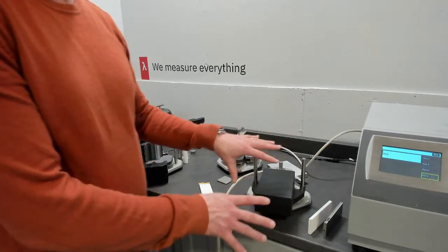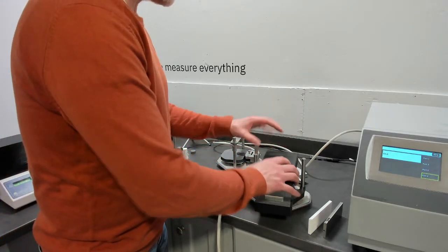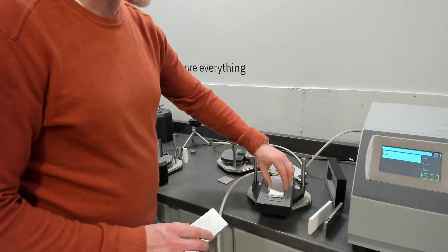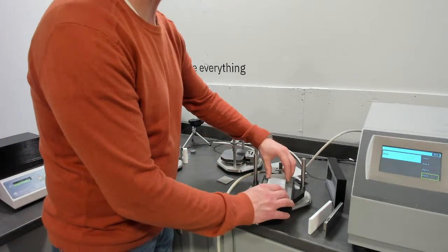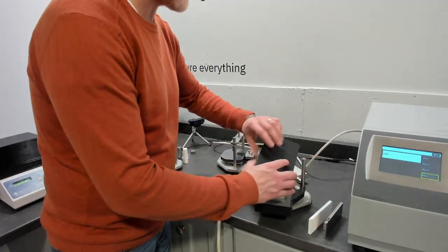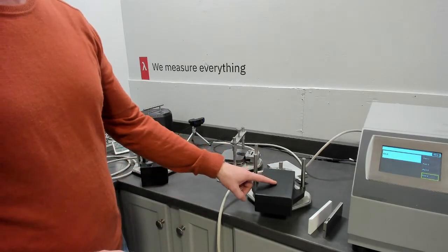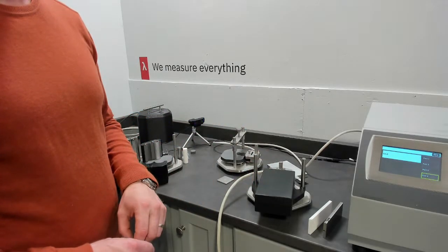So we would run this reference empty and then save that reference. You'll see that in the software, and then put your sample inside and repeat that process. And then the software would calculate the amount of energy to heat up the sample versus the empty cell. And that's the setup.